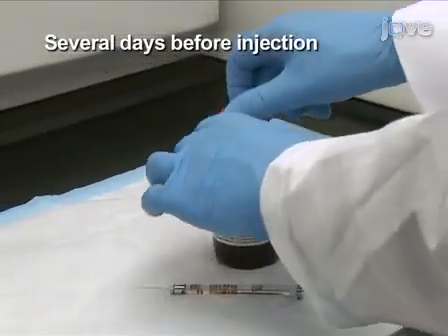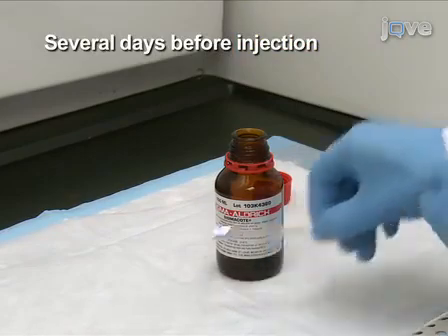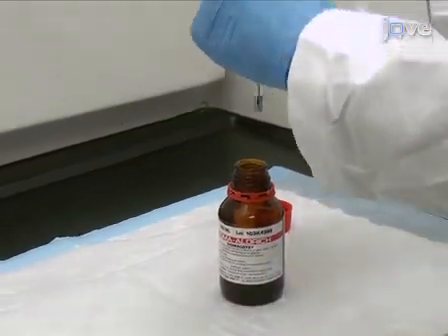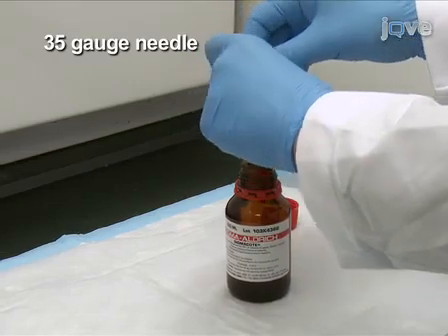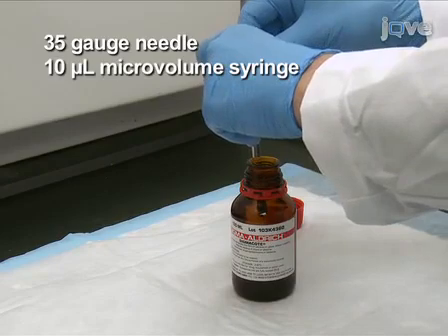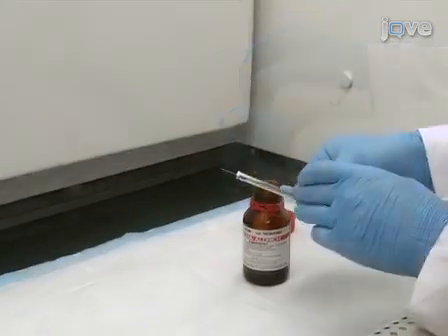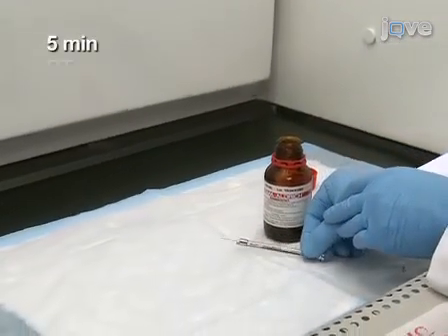To prevent TAT deposition onto the syringe and needle during the injection, days before injection, silanize the inner lining of a 35 gauge needle and 10 microliter microvolume syringe by withdrawing silanizing solution until it fills both the needle and syringe. Allow the solution to sit for 5 minutes at room temperature.